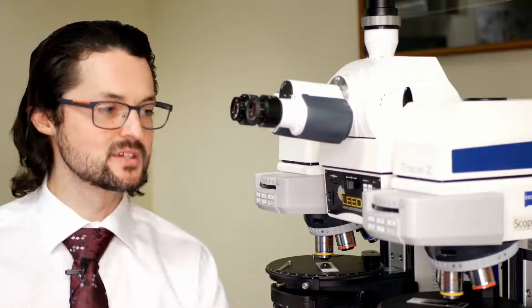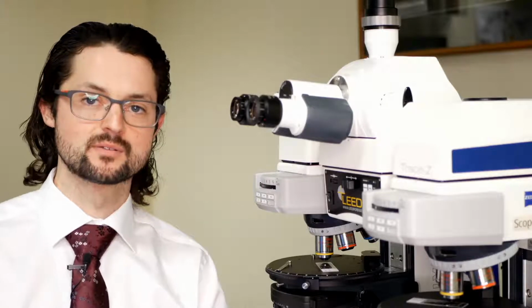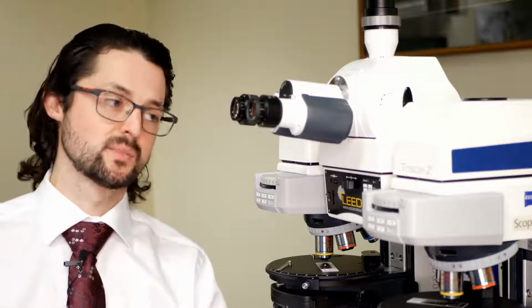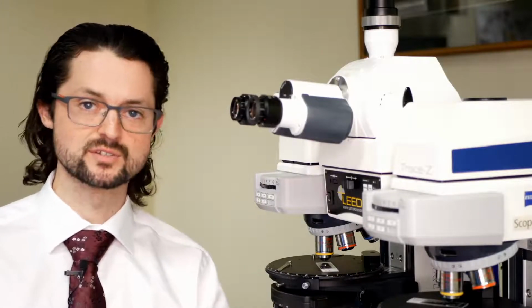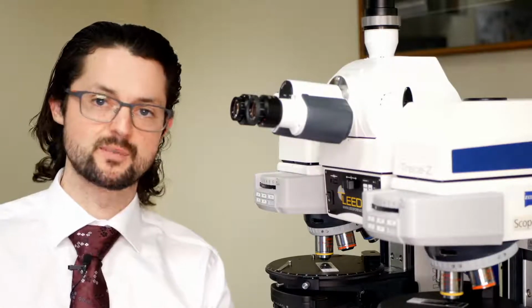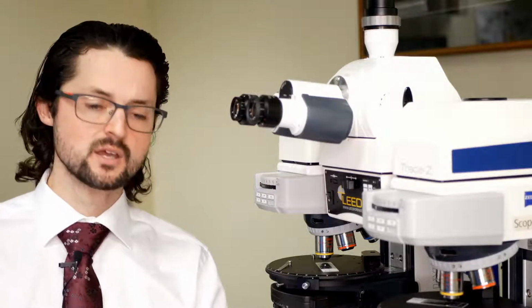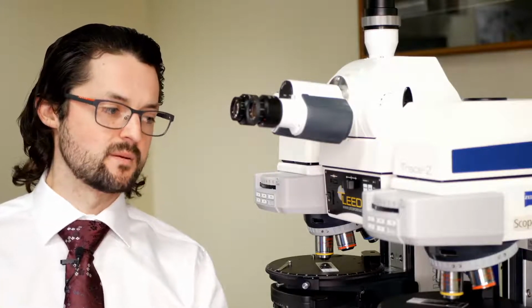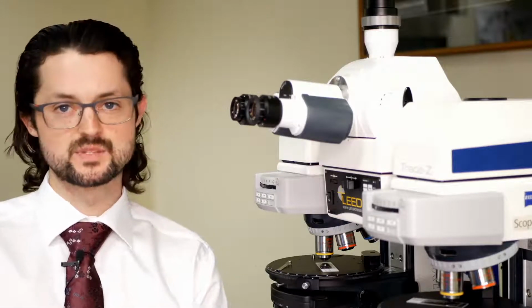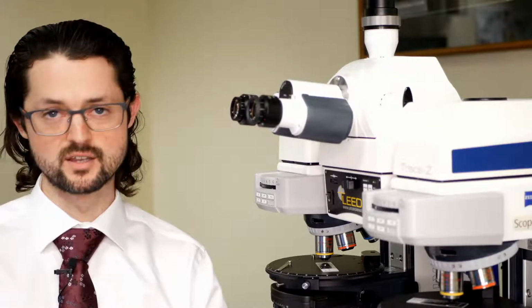So the microscope you see next to me is the Trace Z comparison microscope. It's one of our two models of trace comparison microscopes that we sell, both the Trace Z as well as the LCT comparison microscope. And today, while I have the system here, really everything I'm talking about can be used on both of our comparison scopes. So one of the big topics that comes up with trace comparison work is having multiple different types of techniques to look at two samples. Maybe one is known, one is unknown.